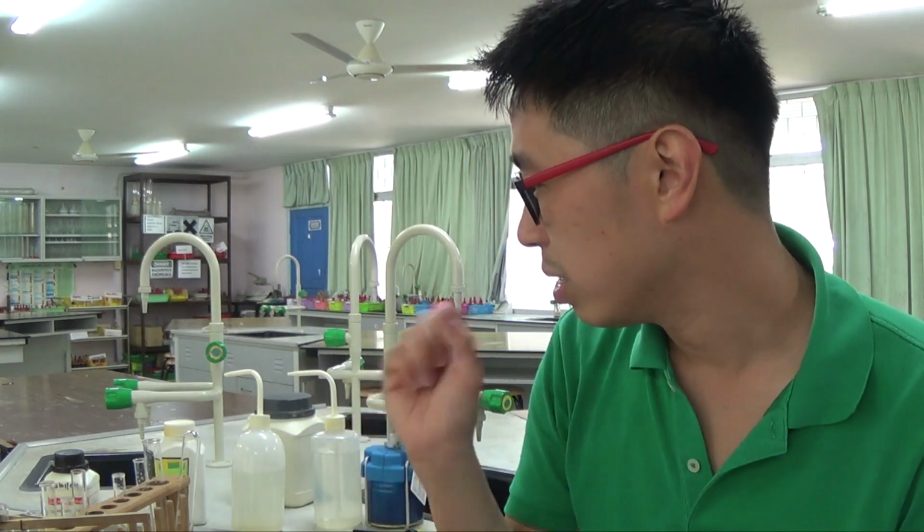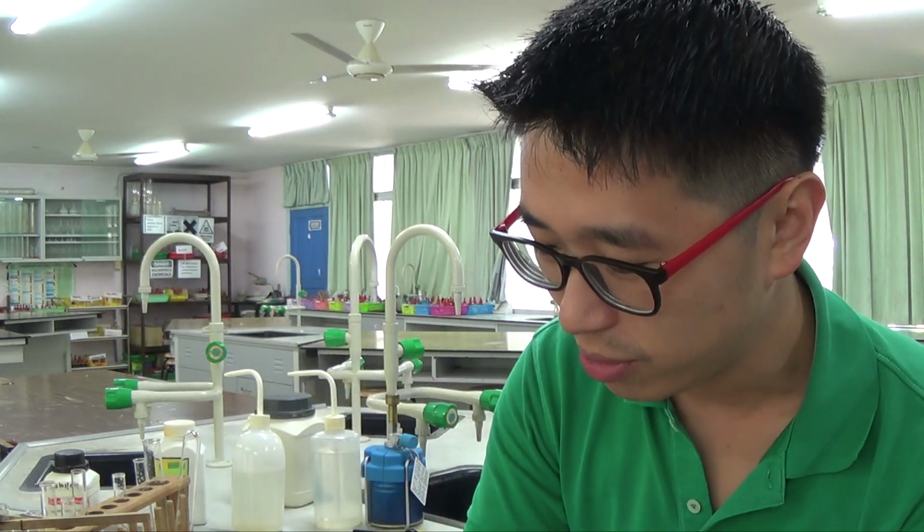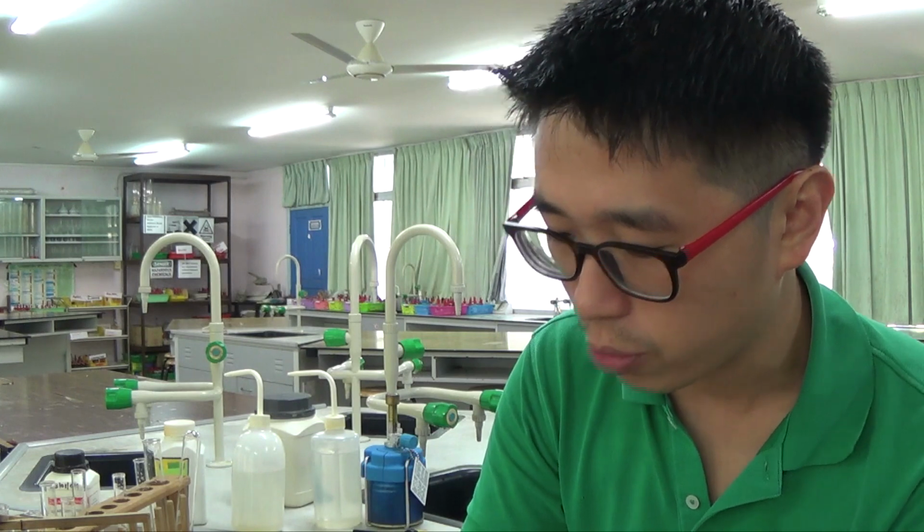Alright? Now I'm going to test for the cations. So test for Fe2+ first. Remember you have 2 cations: you have Fe2+ and you have NH4+.